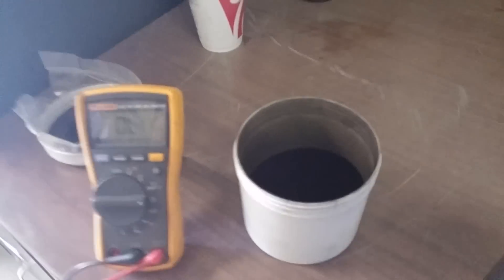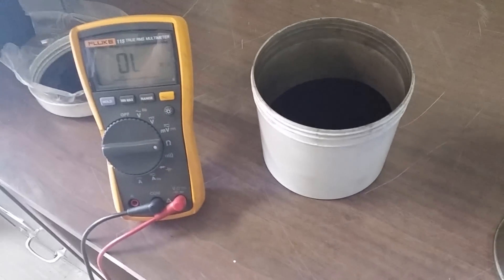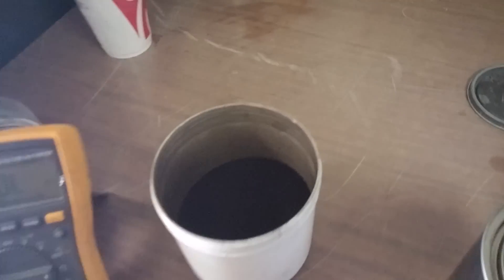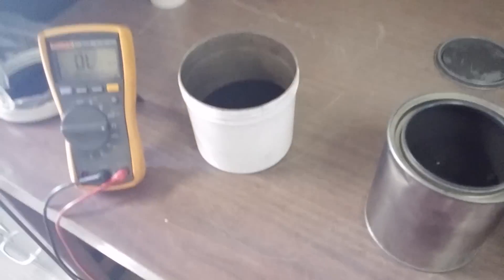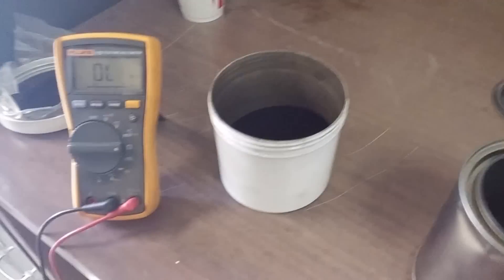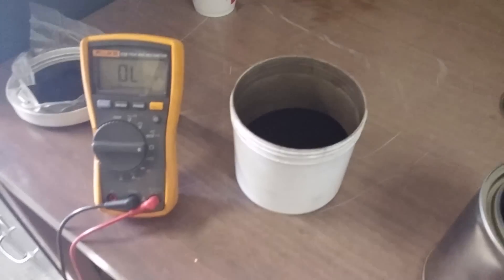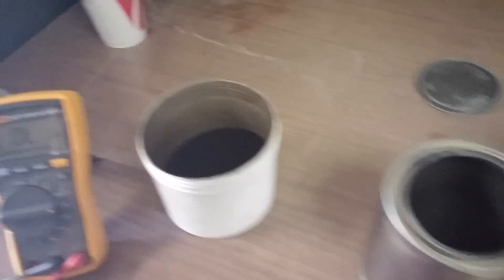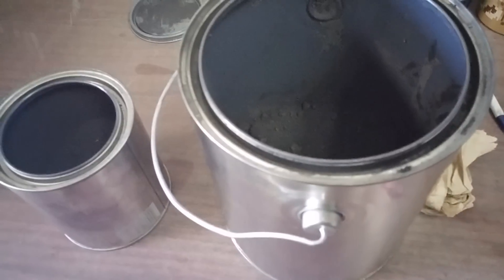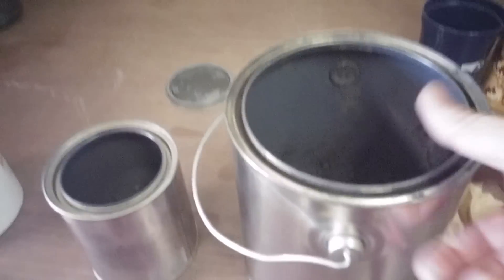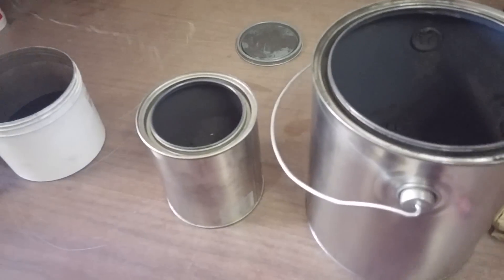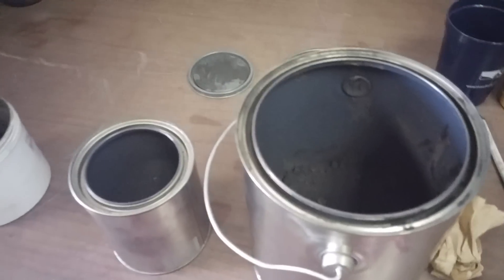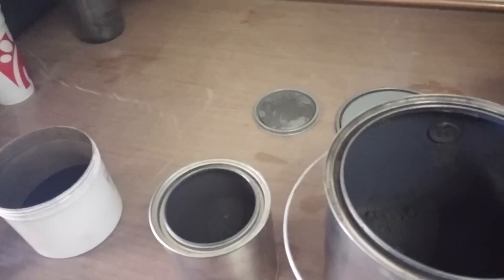This is a commercially available graphene product from XG Sciences. Then this is what we were making before in small batches. And this is the cake that we just got dried out using the vacuum oven and some other techniques.